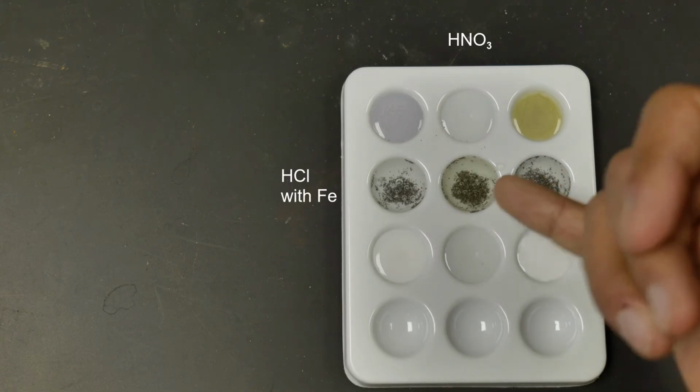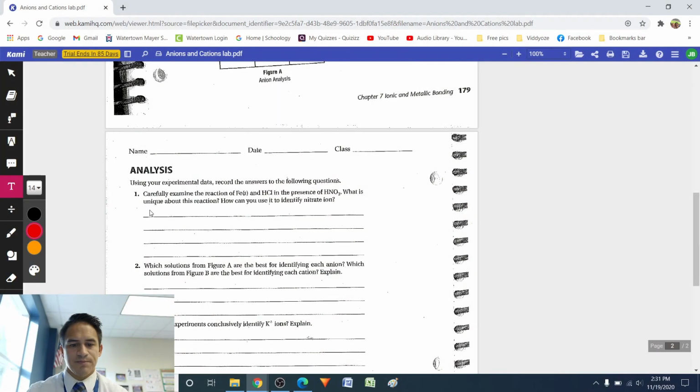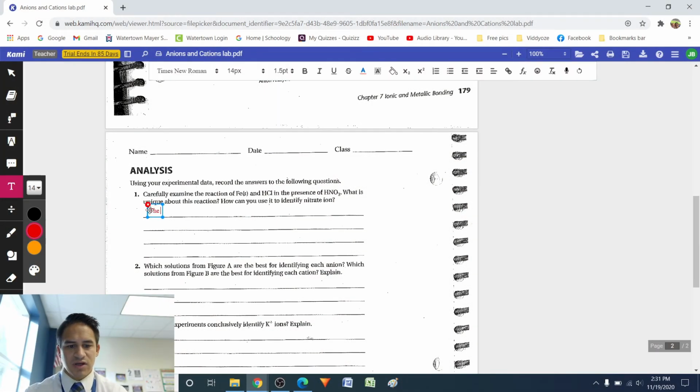So the interesting part about this one that we can put down is the reaction caused the solution to turn slightly yellow. Also, there were bubbles that formed around the iron powder in the spot plate.